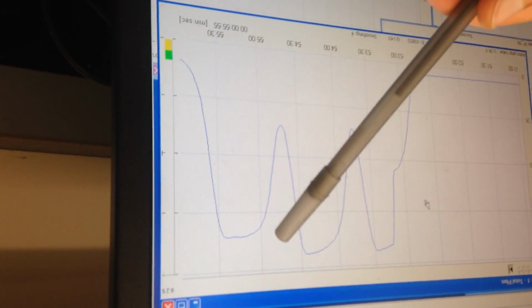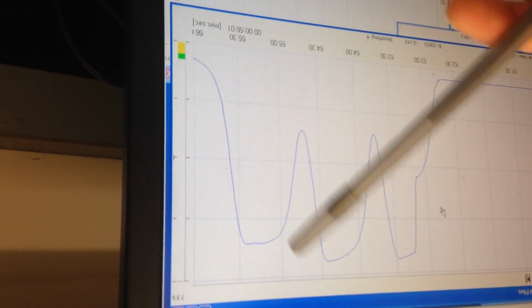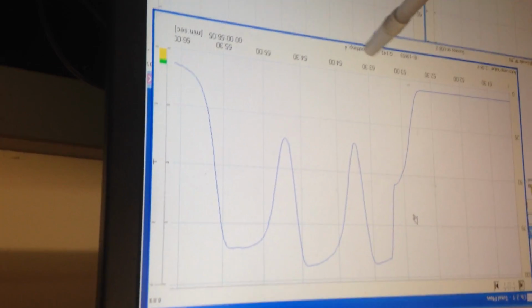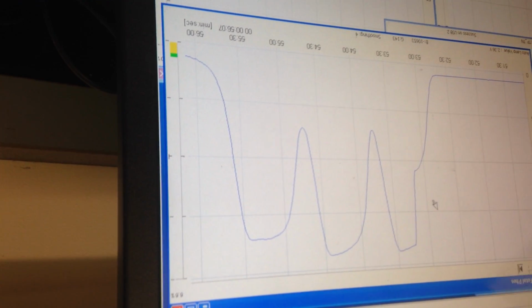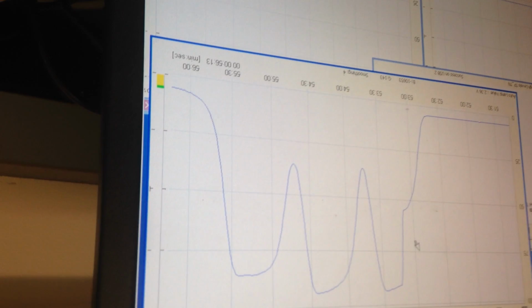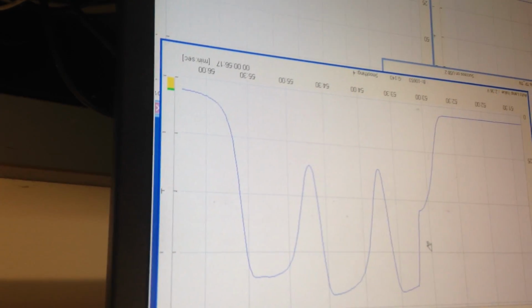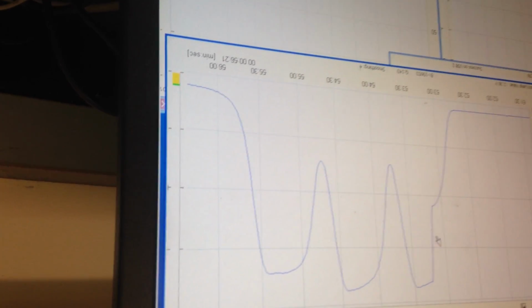And even though this is a little bit lower than that one, it's still above 85%. And I don't want to tell it to go to like 150 or 155, because then it's going to be too strong of a signal. So there's going to be too much gain. So now you're expecting the other spikes for the 901 cup. That was the 901 cup. 910, 901.